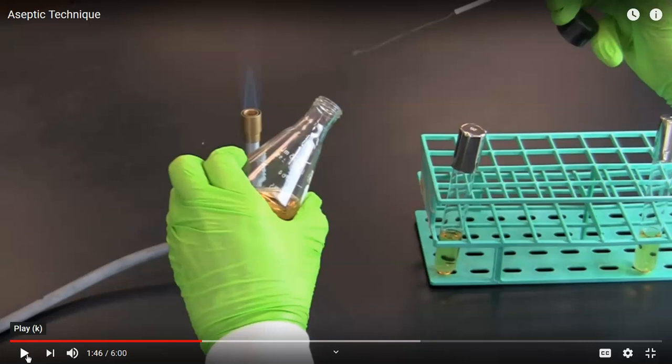Right. If he places the cap onto the desktop, he runs the risk of bacteria from the desktop getting onto the cap. Then when he puts the cap onto the bottle, some of those bacteria may wind up inside the bottle and contaminate the culture. Notice that he's holding the cap so that the open side is facing downwards. That's to keep microbes that might be in the air from landing in the cap, so that, again, once he puts the cap onto the bottle, those microbes won't fall in.